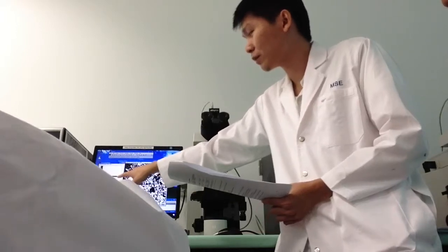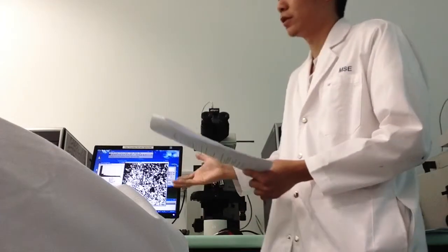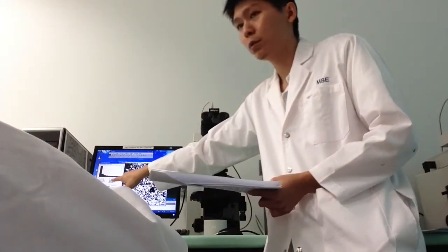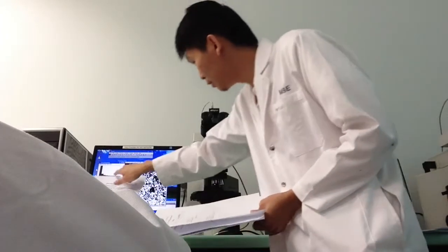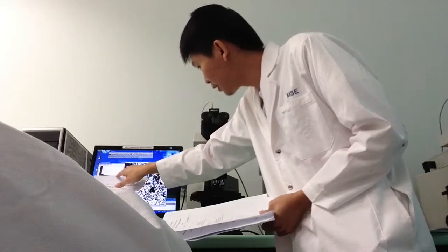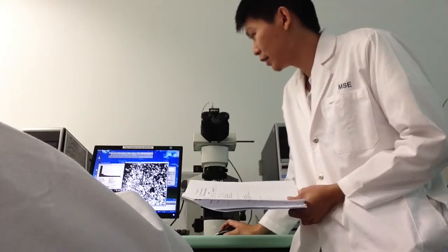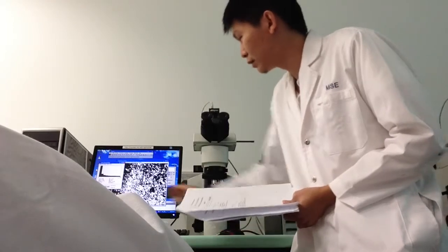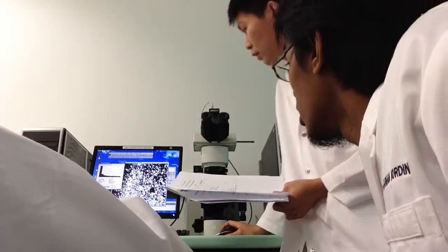What's the last bar? The last bar here, the very small line, just before the flat line. There's one last bar, right? So the value here is 24 for this case. So the range in grain size is 0.915 to 24. It's above the yellow line, very small one. So you just place it under the last bar. Because once you change from here onwards, you can see different numbers, but it's a flat line. So here you have to place it under the last bar.